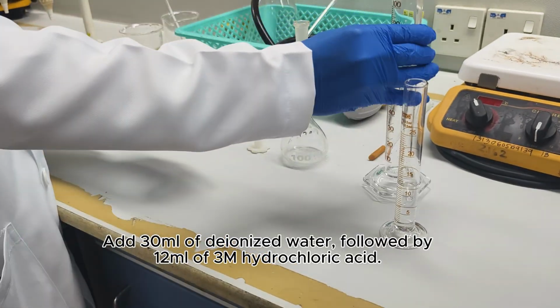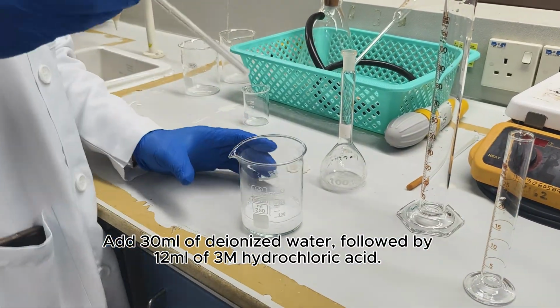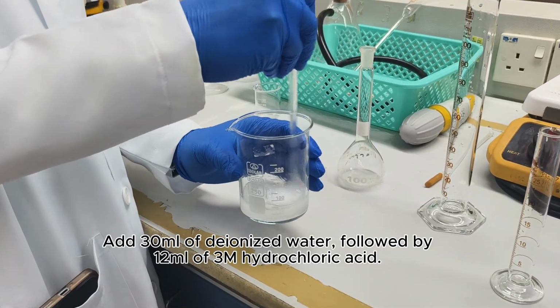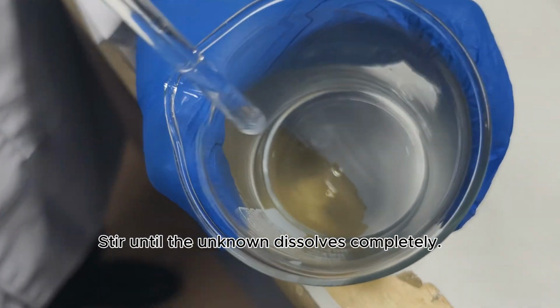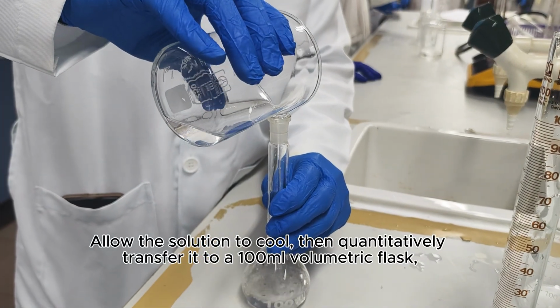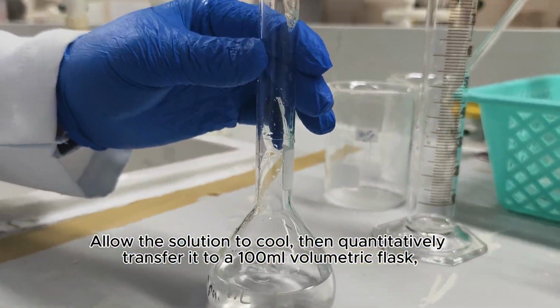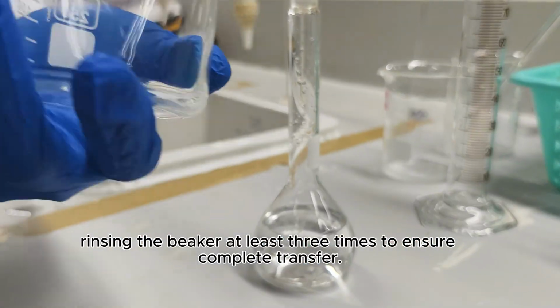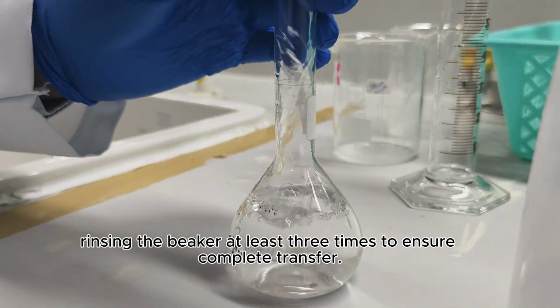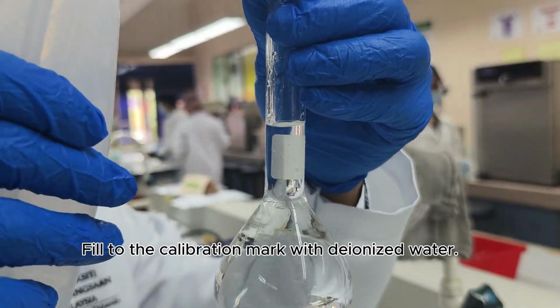Add 30 milliliters of deionized water followed by 12 milliliters of 3 molar hydrochloric acid. Stir until the unknown dissolves completely. Allow the solution to cool and quantitatively transfer it to a 100 milliliter volumetric flask, rinsing the beaker at least 3 times to ensure complete transfer. Fill to the calibration mark with deionized water.